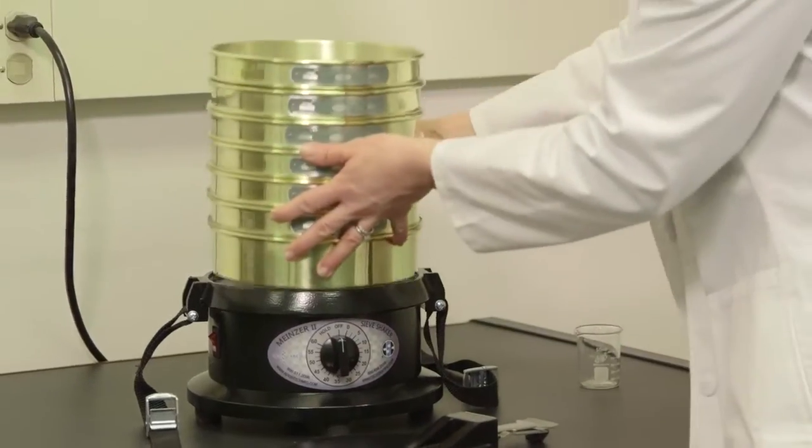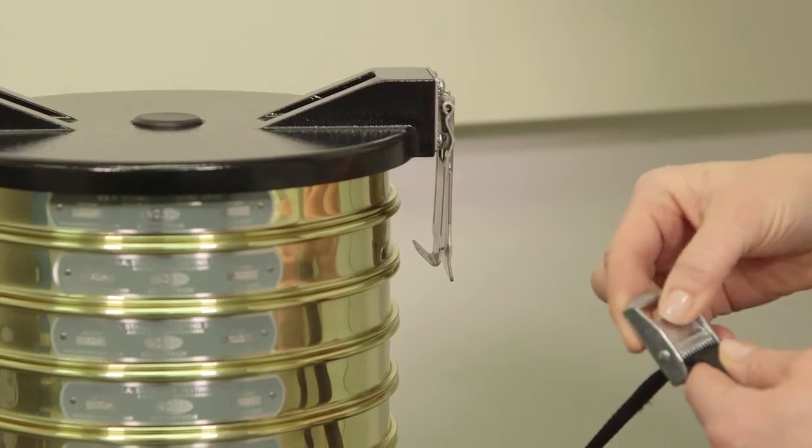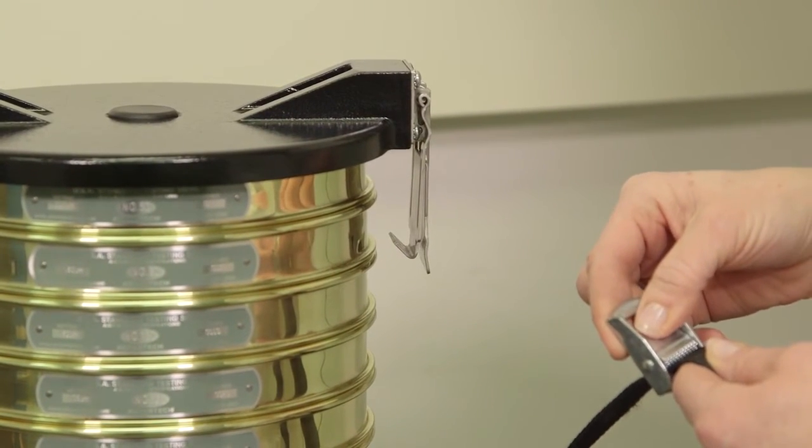Place the stack on the bottom plate. Add the Meinzer cover. Adjust the cam buckle to lengthen the strap if necessary.